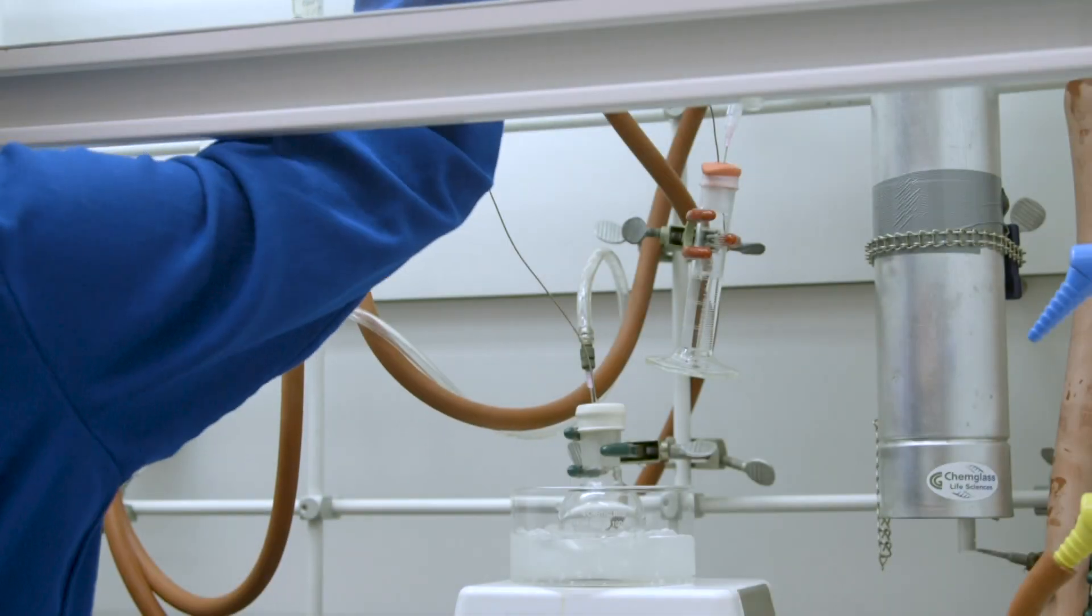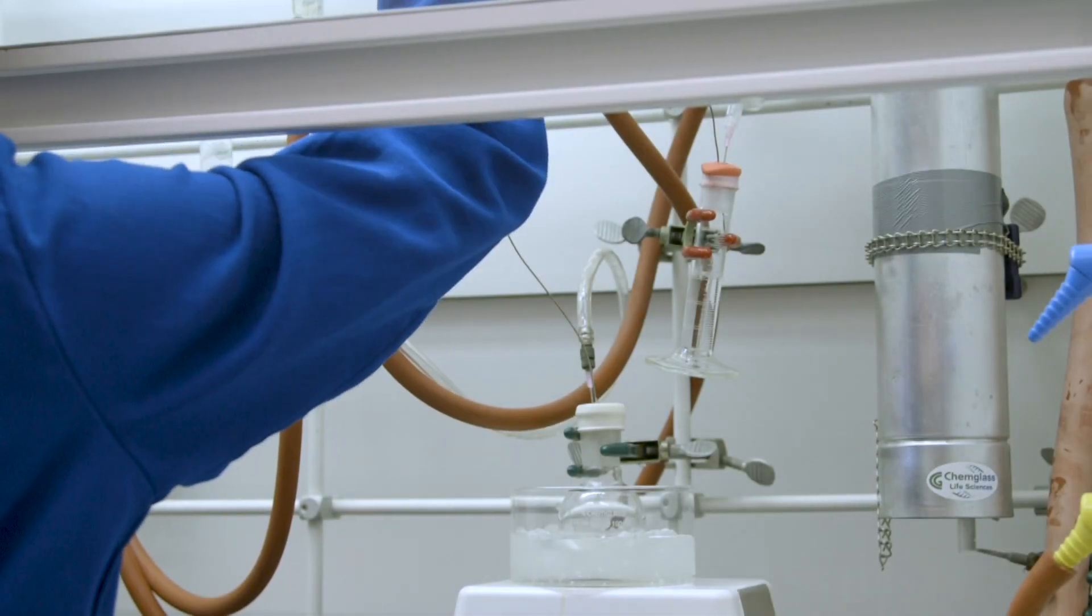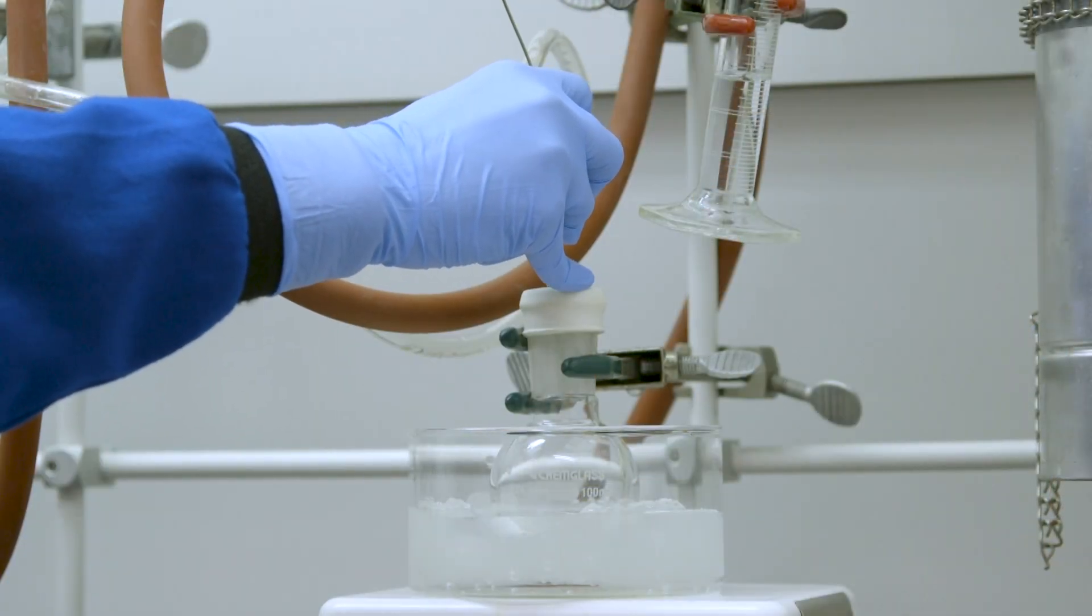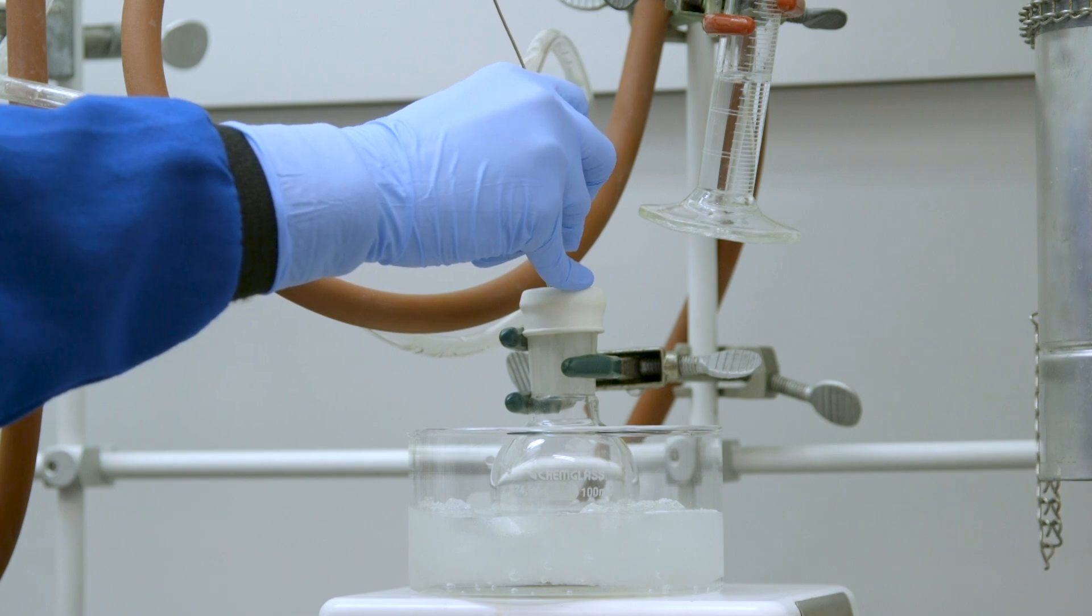You may repeat the above cannula transfer as needed depending on your measuring technique for that reaction. The reaction is initiated as per your procedure, closely monitoring the rate of reaction.